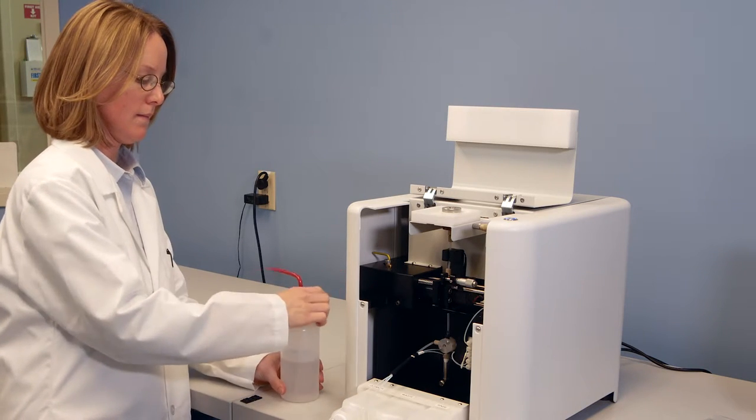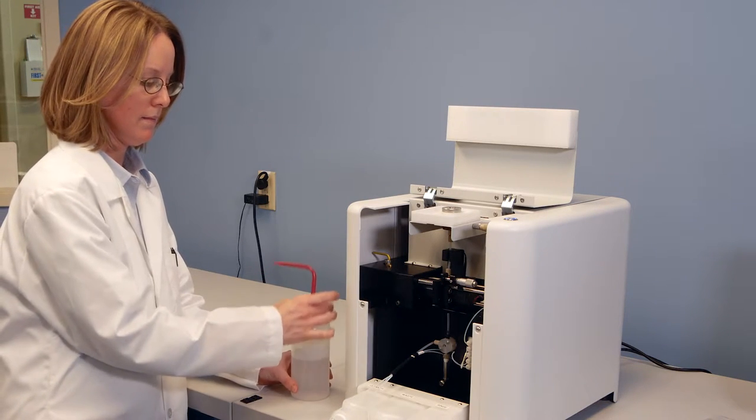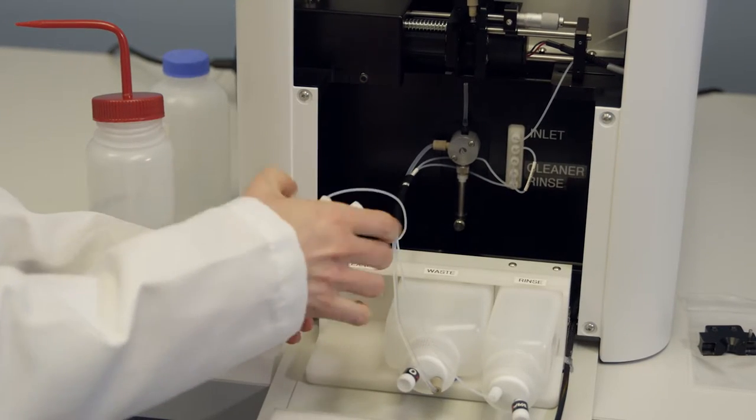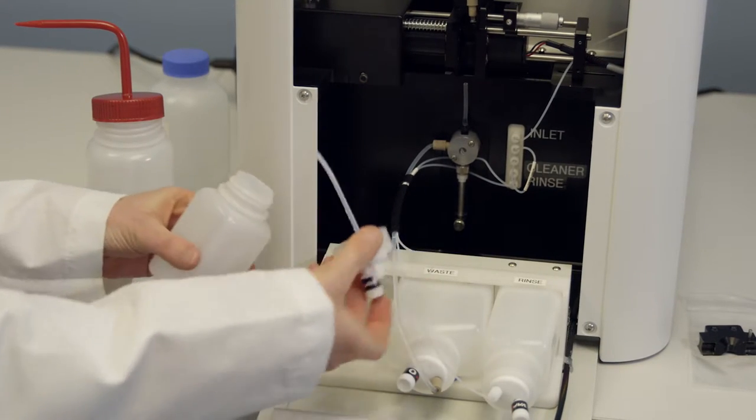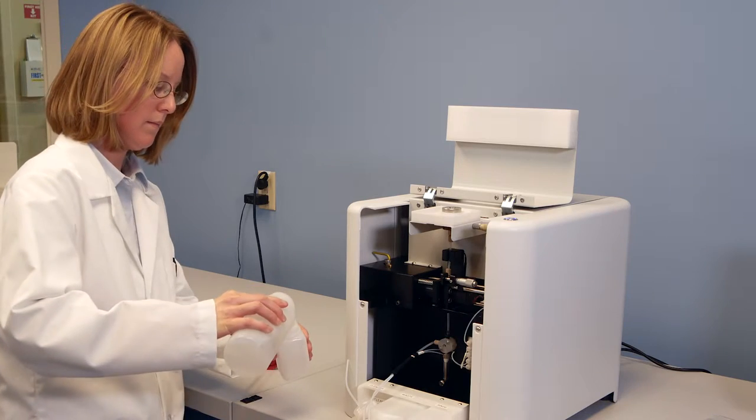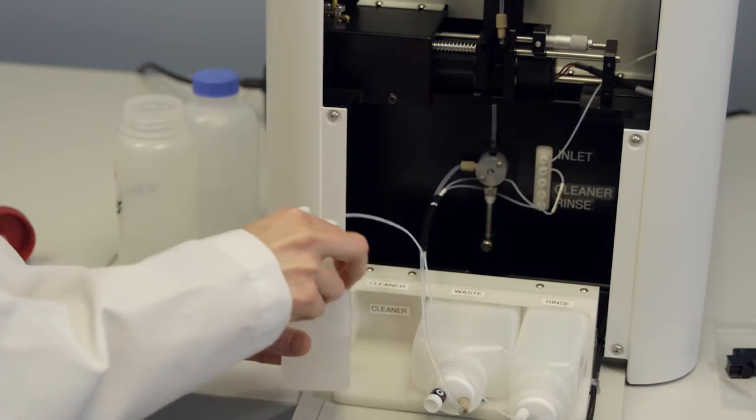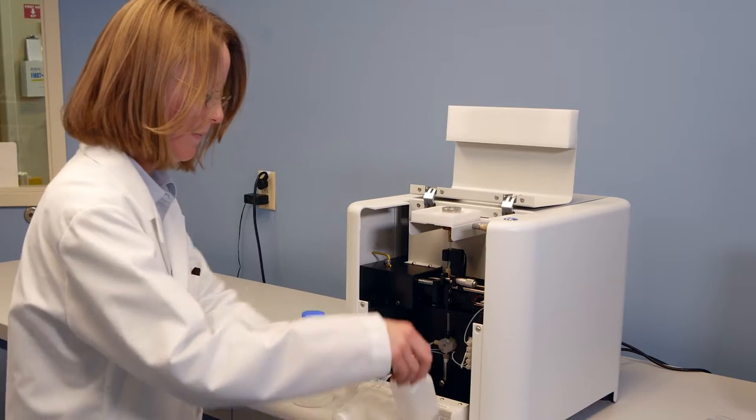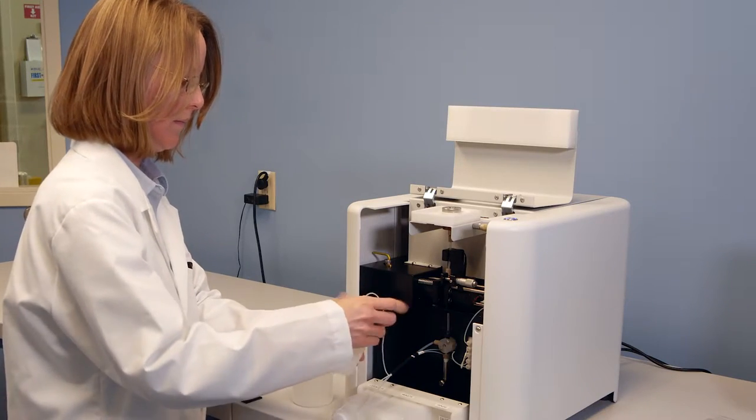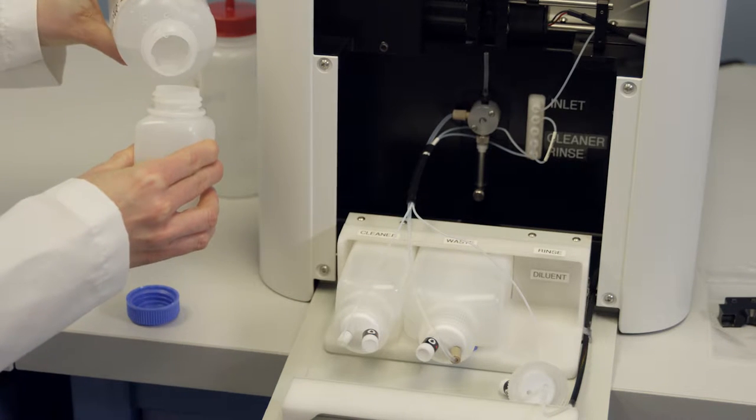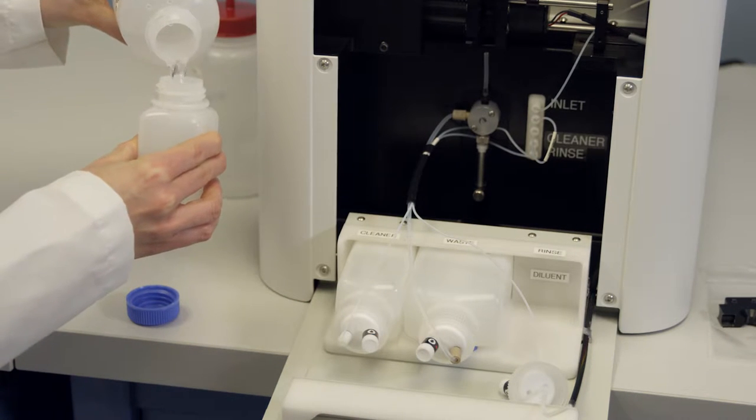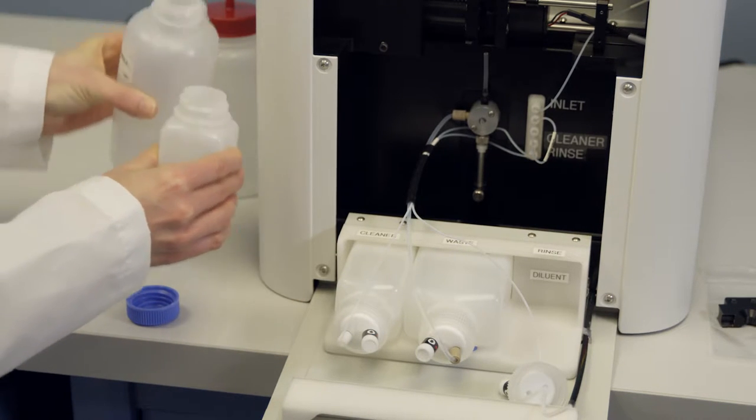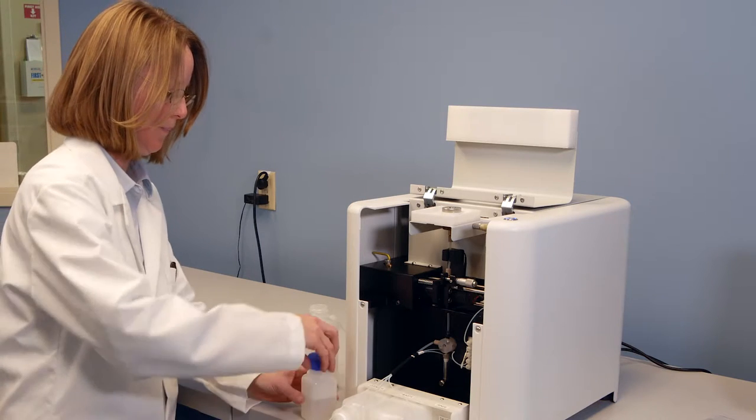fill the appropriate bottles with the corresponding rinse and cleaning solutions you would like to use with your first sample. Keep in mind that the cleaning bottle should be filled with a more aggressive solvent for removing remaining particles in the system, and the rinse bottle should be filled with the final solution that will go through the system before more samples are introduced. In many cases, this will be water or buffer that you use to produce your sample or something similar.